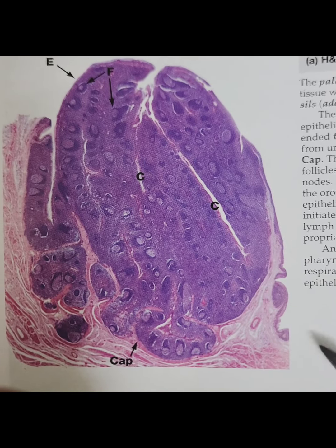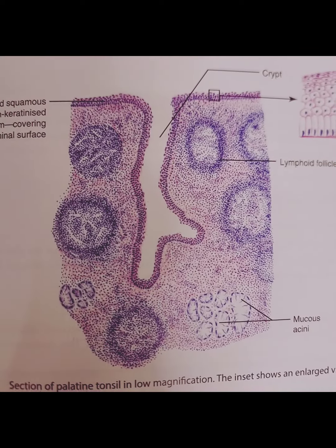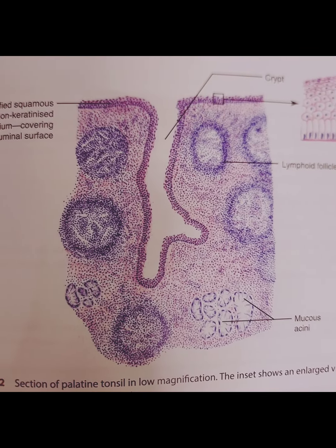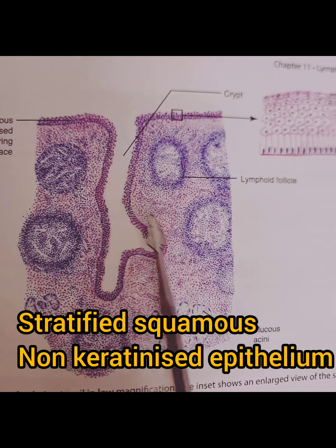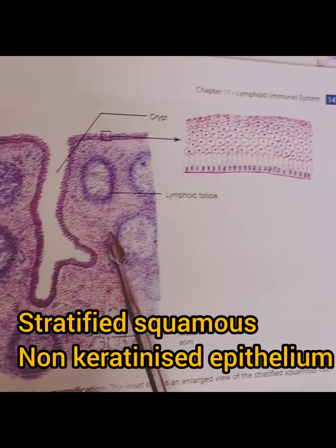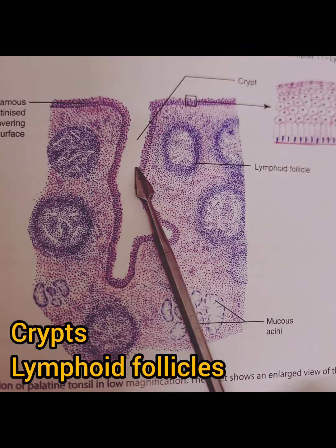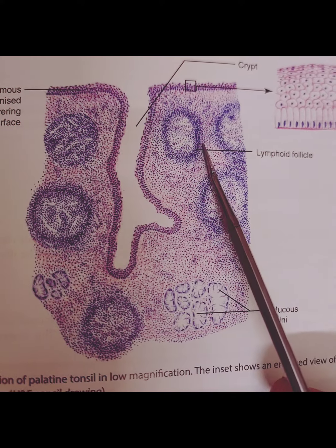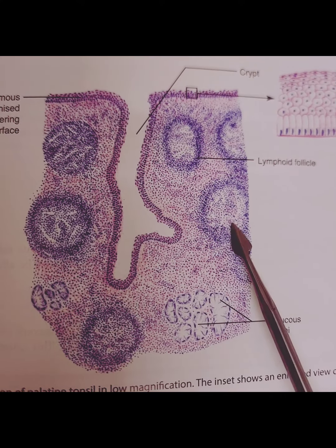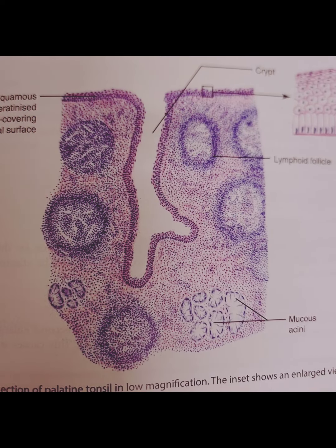Sections sometimes show glandular tissue and skeletal muscle fibers. This is a diagrammatic representation of palatine tonsil. Identification features: it is lined by stratified squamous non-keratinized epithelium. It shows crypts, and just below the epithelium, we see lymphoid follicles. They can show primary and secondary follicles with germinal centers. Sometimes acini or glandular part and skeletal muscles can also be seen.